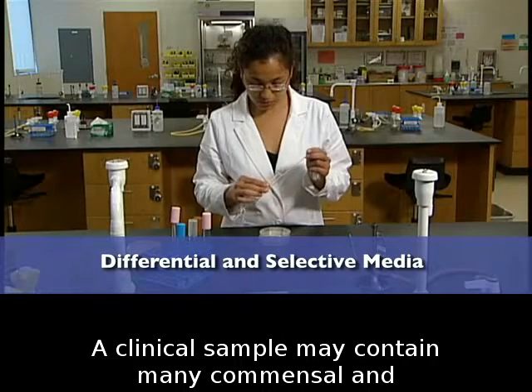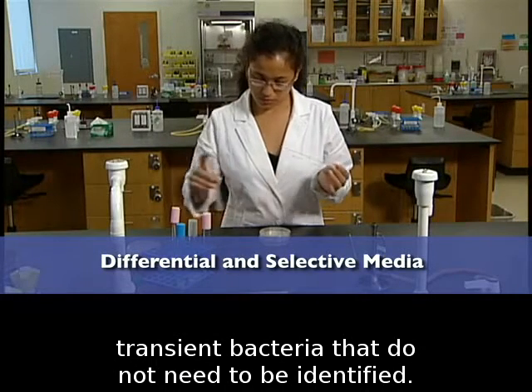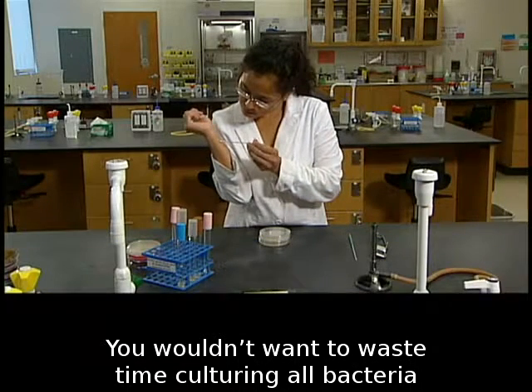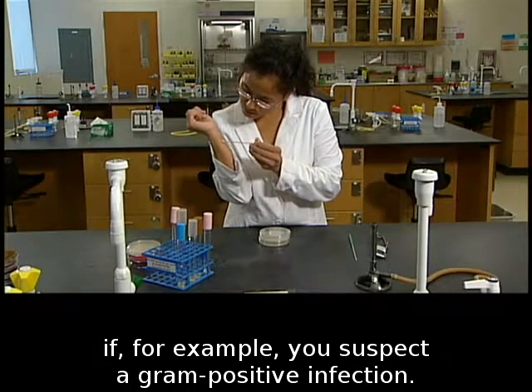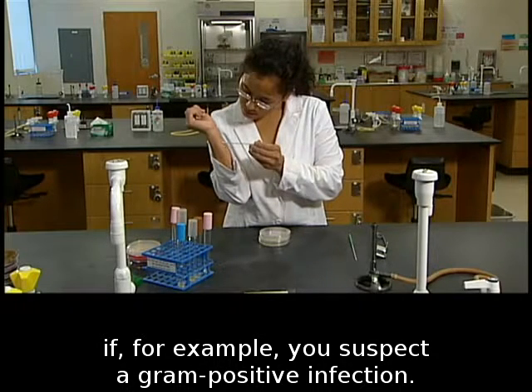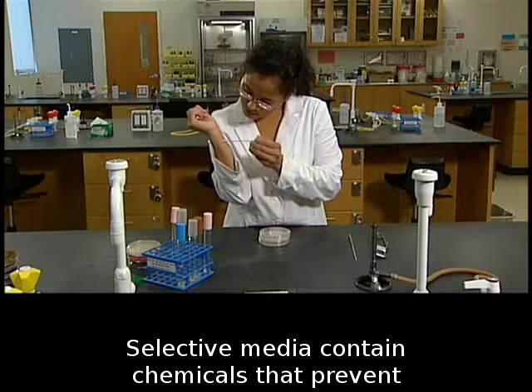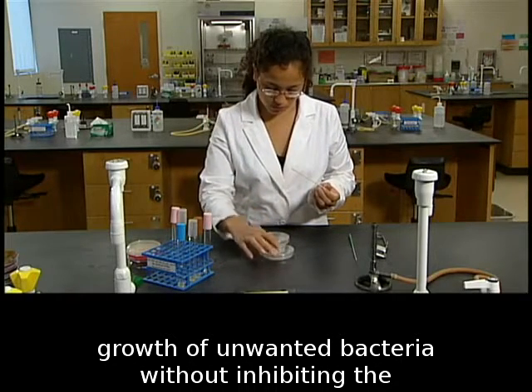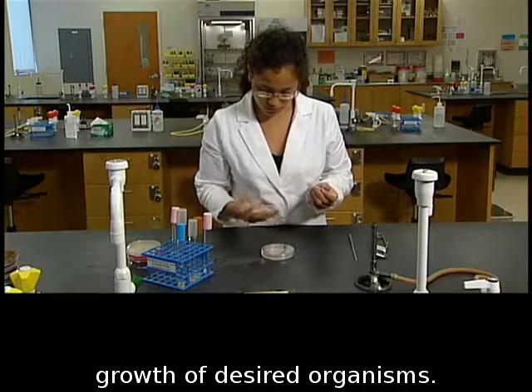A clinical sample may contain many commensal and transient bacteria that do not need to be identified. You wouldn't want to waste time culturing all bacteria if, for example, you suspect a gram-positive infection. Selective media contain chemicals that prevent growth of unwanted bacteria without inhibiting the growth of desired organisms.